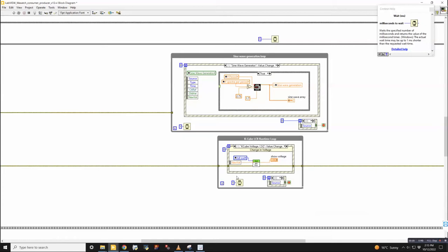It's nice to be at least 10 times faster than that on the wait timer. 1 millisecond tends to work well. It really depends on the thing that you're looking for too. If it's a stage that I'm trying to move, then a millisecond or maybe even less may be necessary because you want it to respond as quickly as possible. But if it's something like updating a file name, you don't need to respond in 1 millisecond. You can have this wait 100 milliseconds and that'll still, to your eyeballs, look instantaneous. But in the software, that loop runs 100 times slower. So that tends to save a lot of strain on the processor.